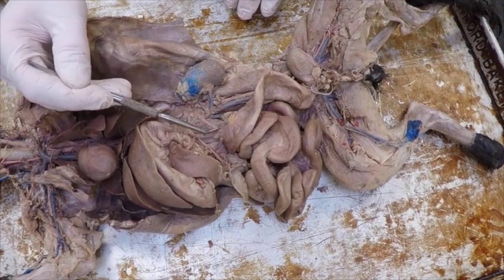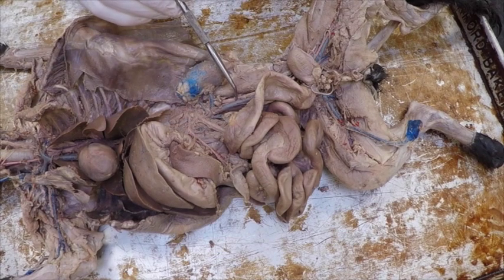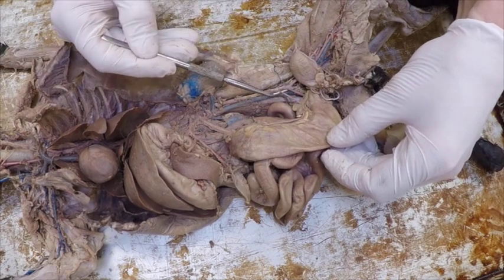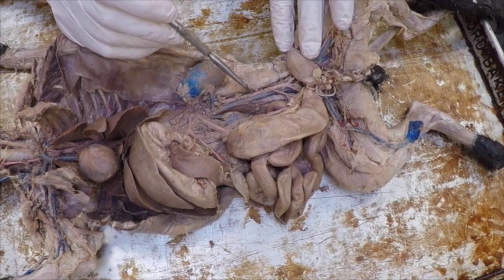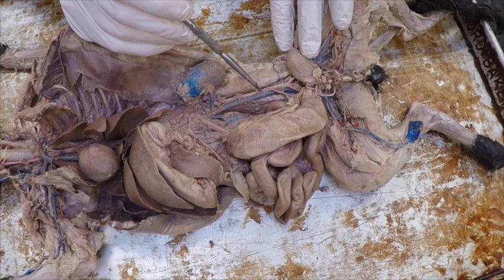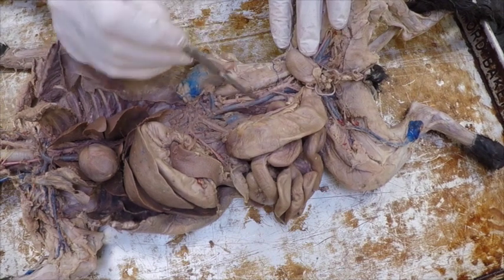So this is my superior mesenteric, which means if I follow my abdominal aorta on down and I get to the other side of the digestive organs, here's an inferior mesenteric. There are some I didn't talk about with the veins, but there are some that go directly underneath the inferior vena cava and the abdominal aorta. They go down to the lumbar vertebrae, and I can see them.